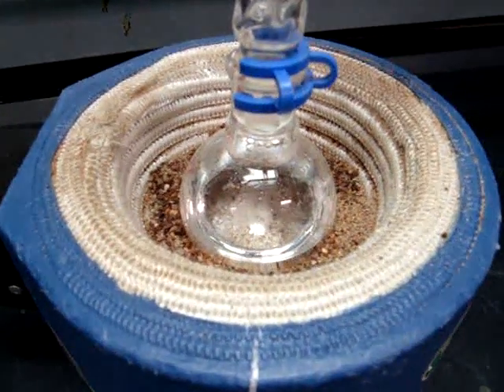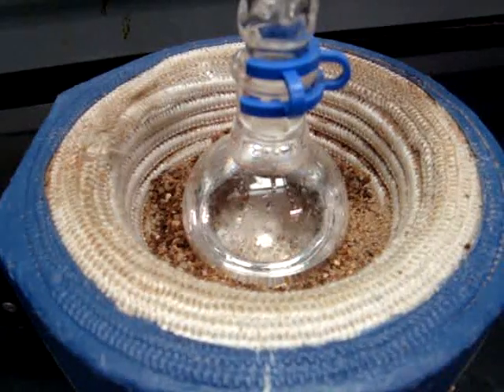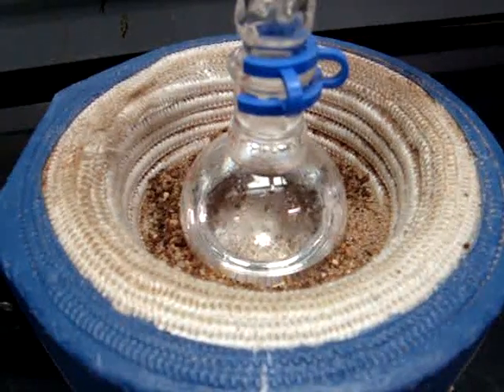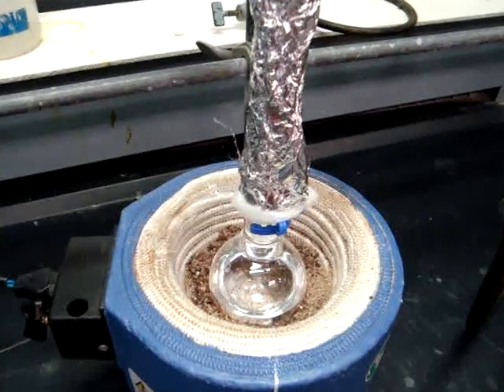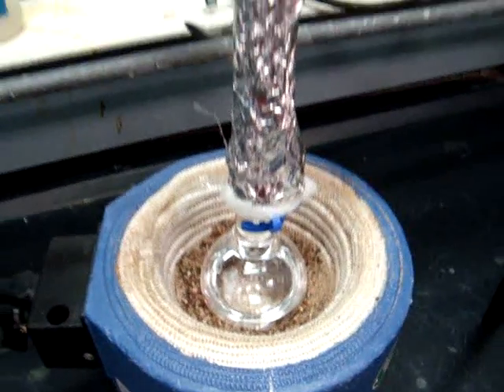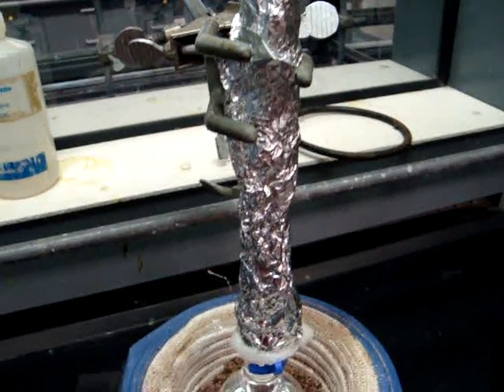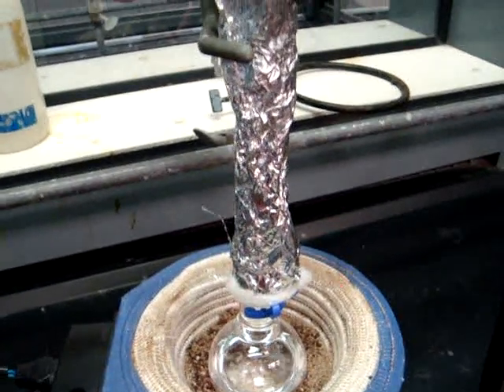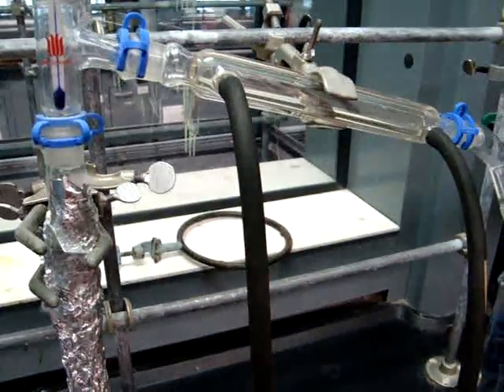Our mixture is already starting to boil, so you want to turn down the power slightly, making sure that you're heating it slowly. The mixture is boiling; we have wrapped the column in cotton and surrounded it with aluminum foil. You also want to make sure that your water out line is going into the drain — we don't want anything to slip and make a mess on the bench.